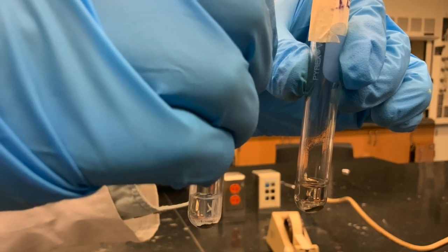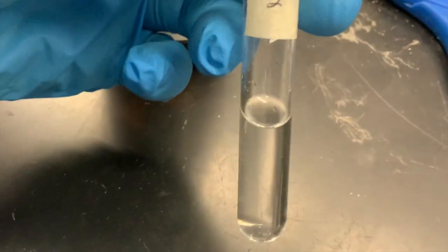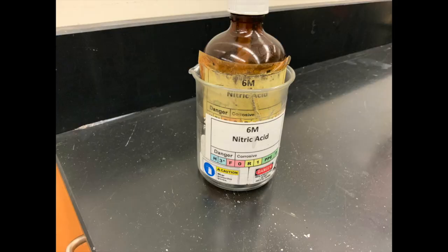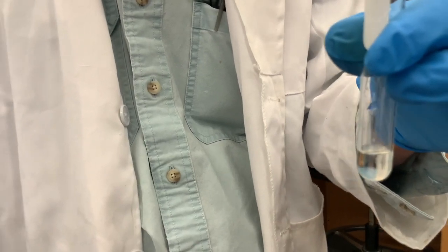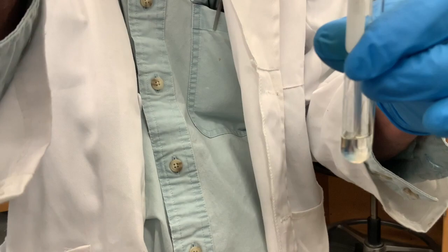This is what the positive control and sample 1E look like. Sample 7T just gives a clear solution. We decant the supernatant into 3 clean test tubes. To each, we add enough 6 molar nitric acid to make the solution acidic by litmus. Both the control and sample 7T have this appearance. This marks the end of this experiment.